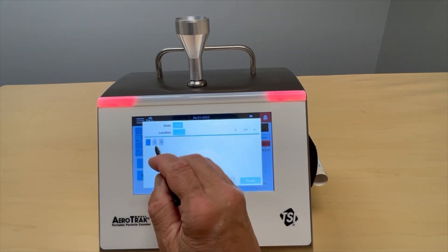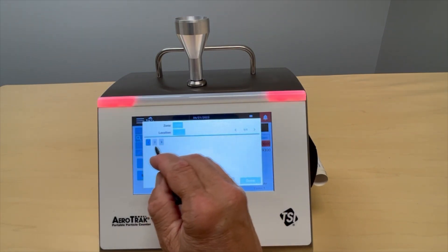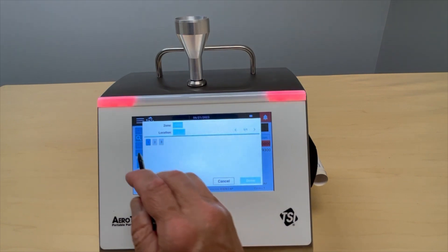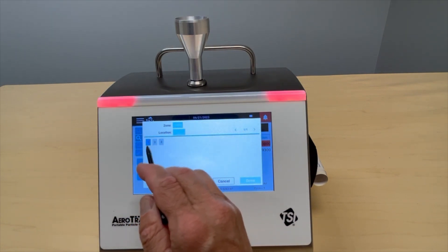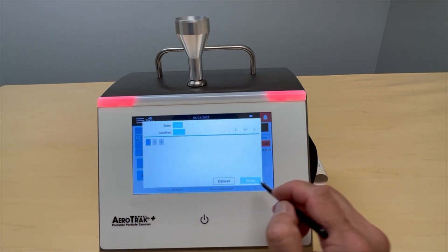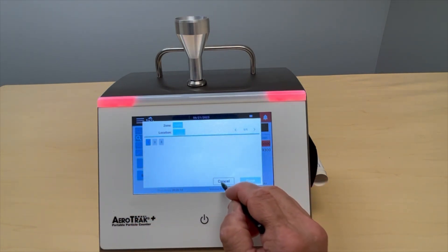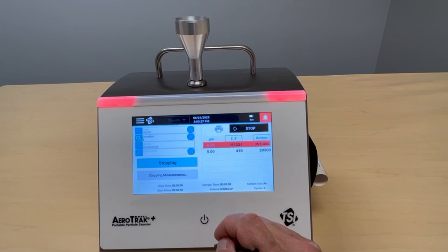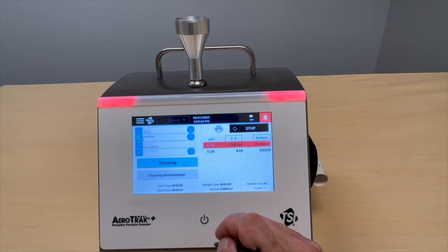You can also look at the sample tracker and see which location you're sampling, and as you sample these locations, they'll change colors to indicate progress through the sample parameters.